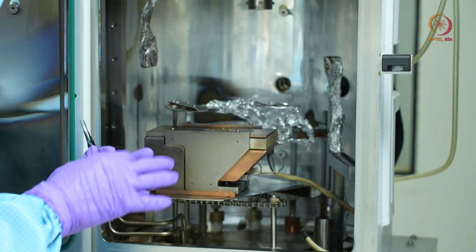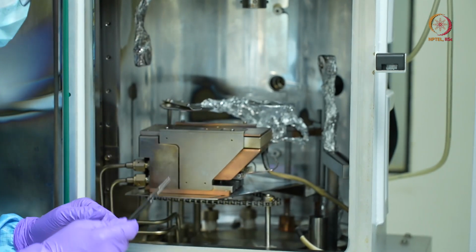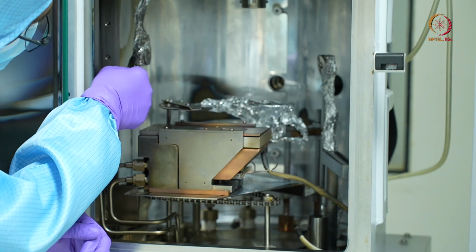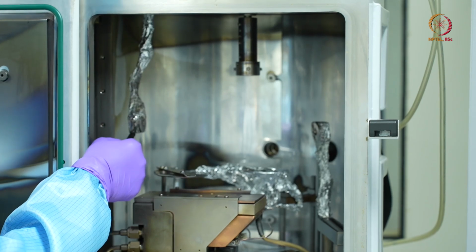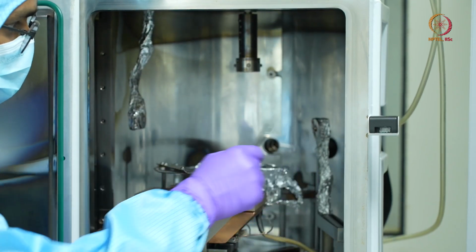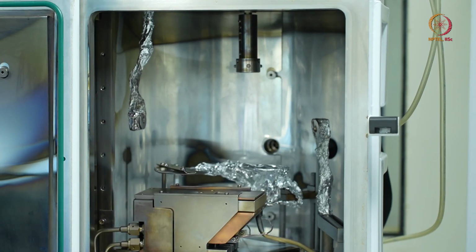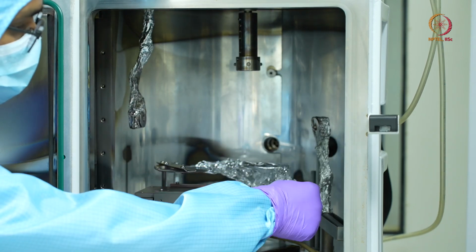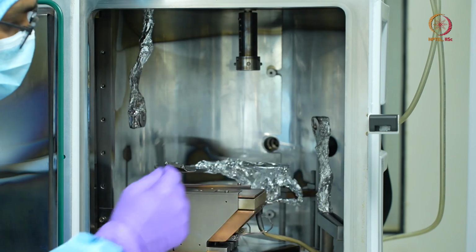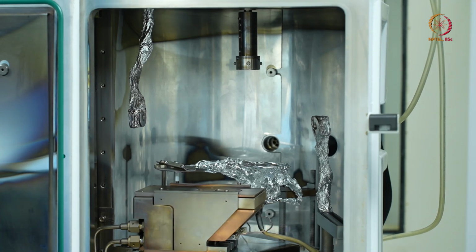So these are the main components of my e-beam deposition. But you will also see there are some extra hanging structures. This is the holder for the quartz crystal. We have one here as well as one here. One is for the electron beam deposition, and one is for the thermal deposition. It is calibrated in such a way. Here we can see there is some other attachment which is covered in aluminum foil. That is the setup for the thermal deposition, which is not in the scope of this discussion today.